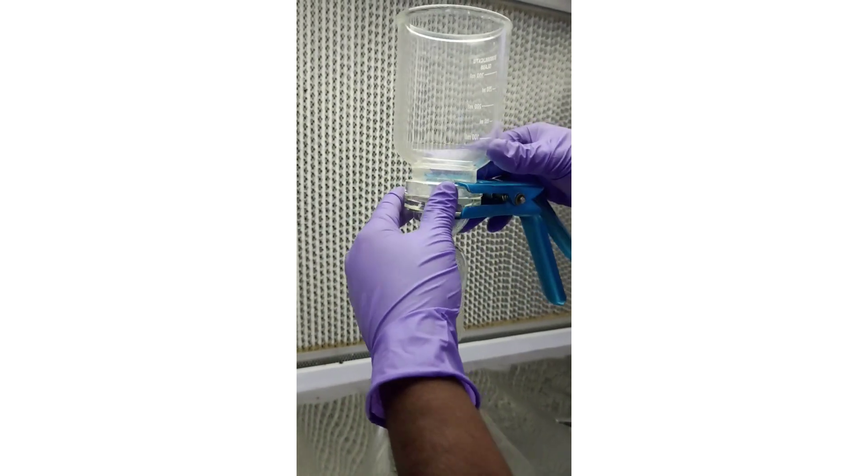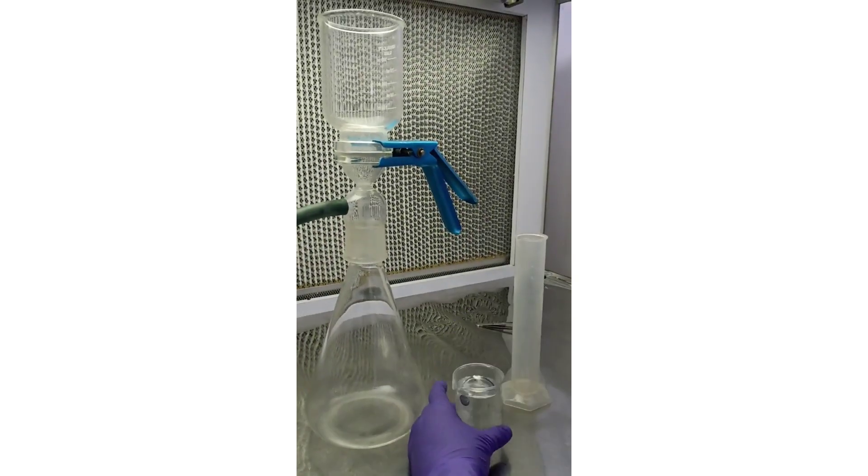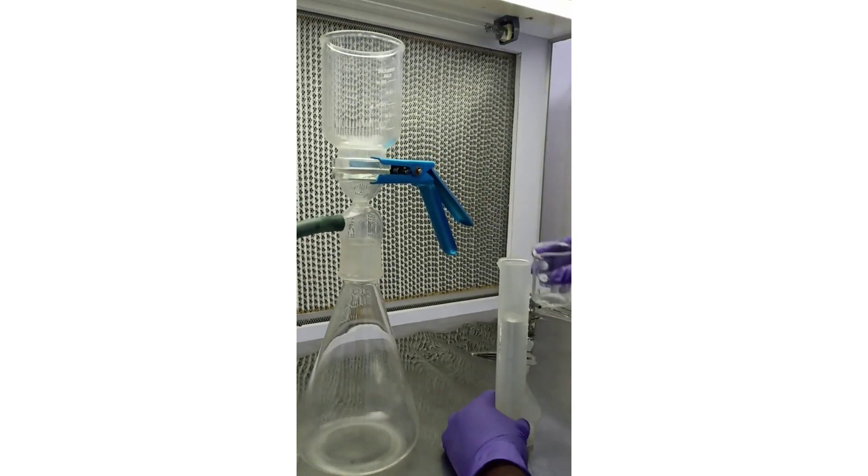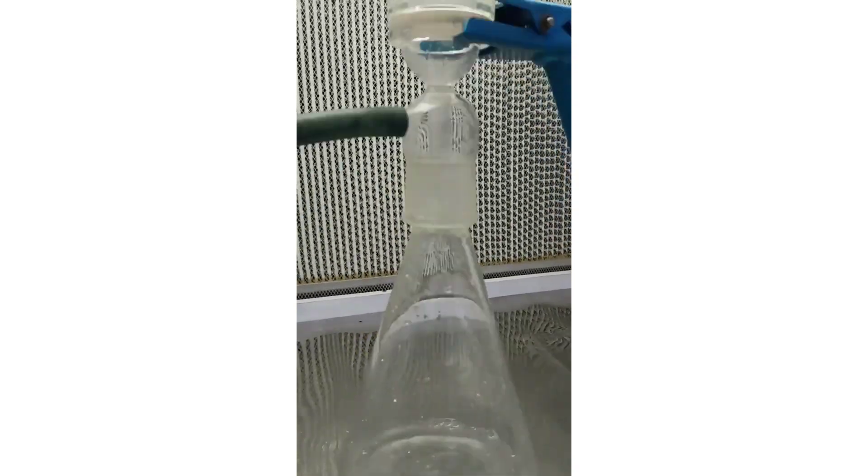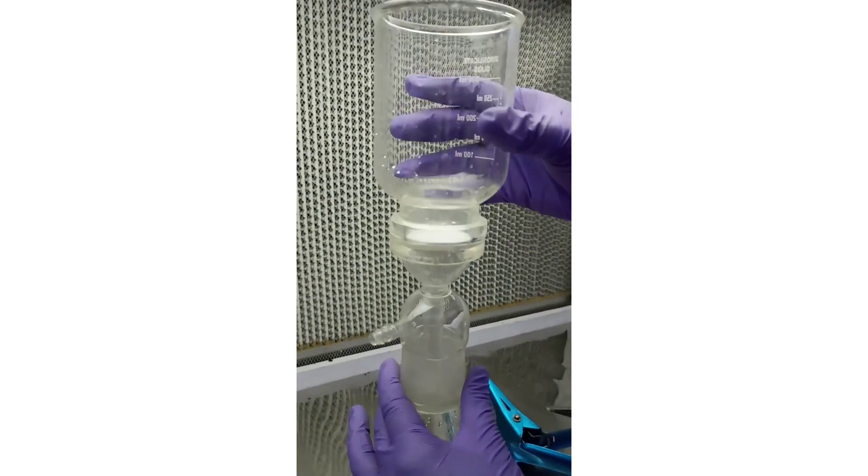Filter the water sample through the filtration setup with the help of a vacuum pump. After filtration, dismantle the membrane filtration assembly.